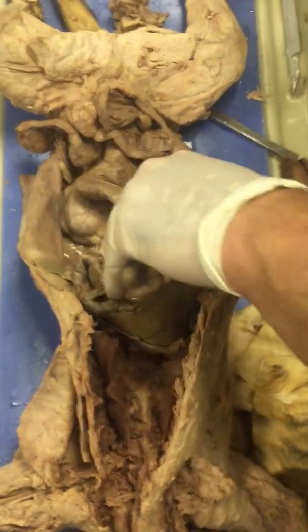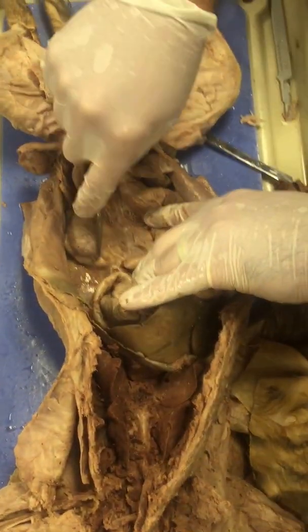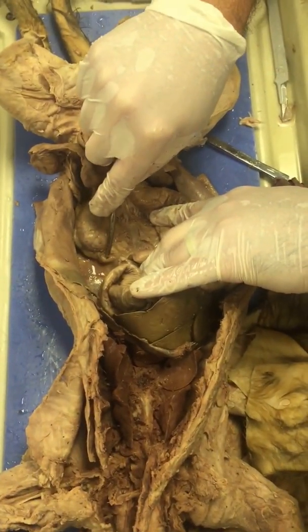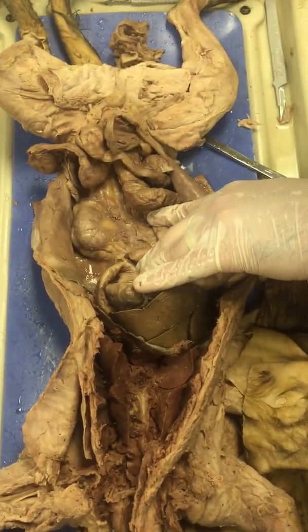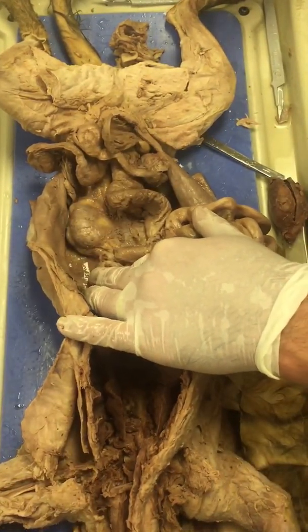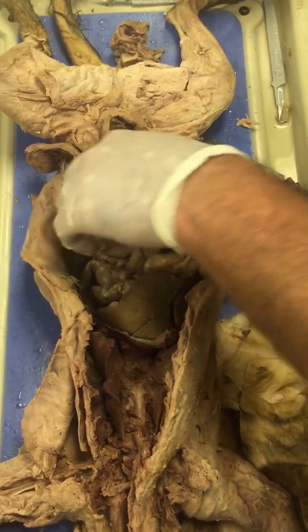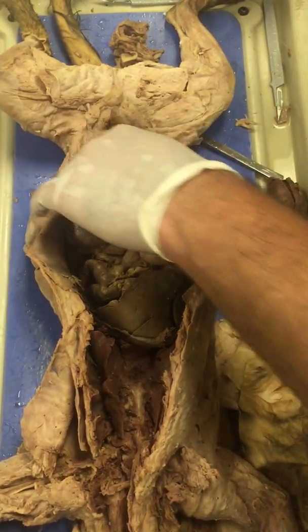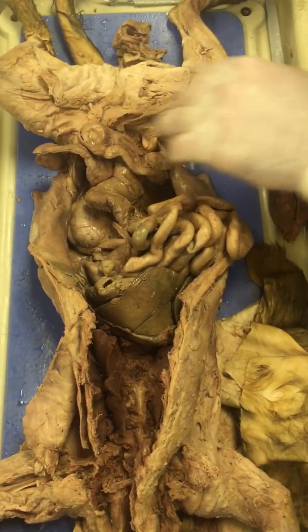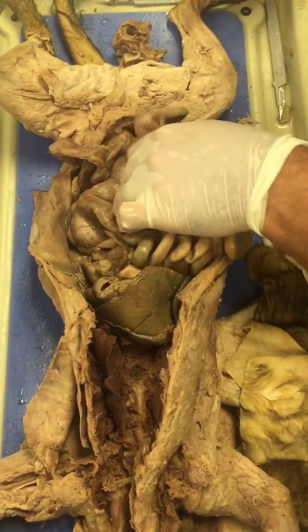Okay, let's see if we... Here, right along the top of the kidneys, you have part of it, it looks like, the adrenal glands. They release adrenaline, or epinephrine, that sympathetic nervous system hormone, the fight or flight response. And we also have here a pregnant cat.